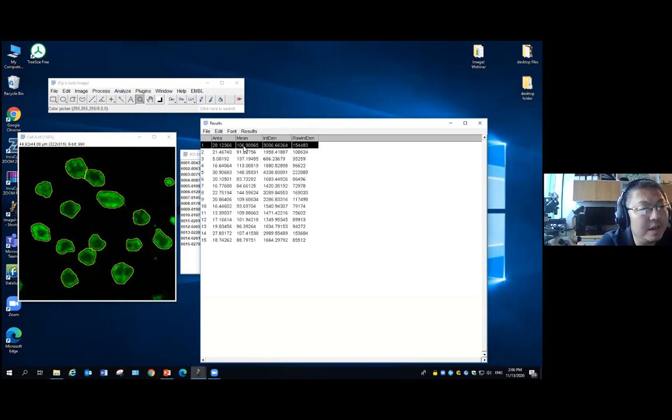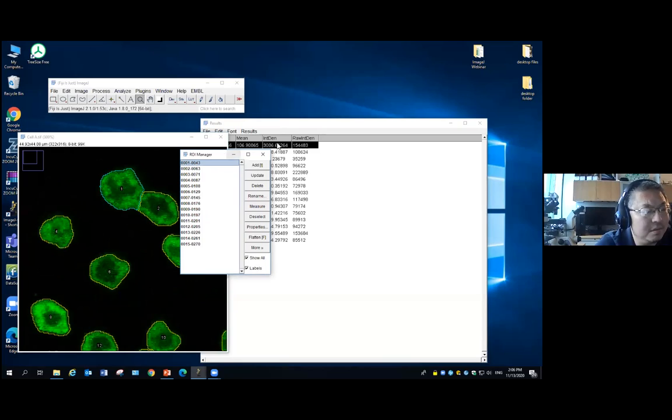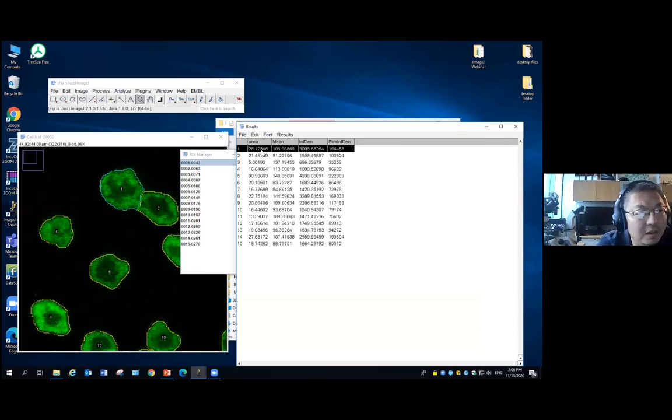So we actually need to know, when we see the first cell, which is this one, number 1, the size is 28.12366. So what is the unit? Is that millimeter squared, micron squared, or nanometer squared? We want to check. To check on this, we need to know what we call the pixel scale information. Because what we're working on is a digital image, that's actually just a matrix, in this case a 2D array. Then we need to know for every single pixel, that's the basic unit inside this image, how big is that?